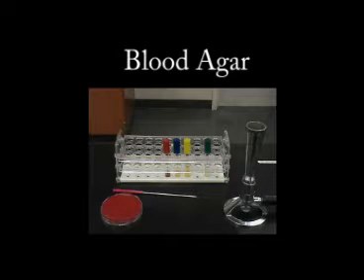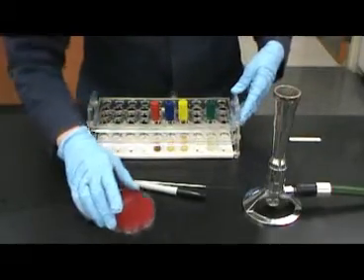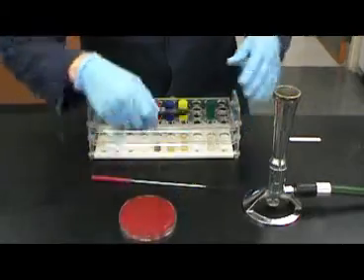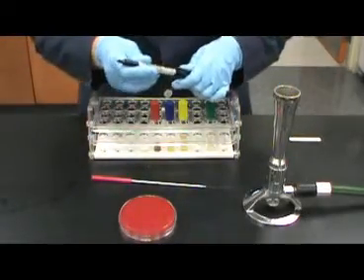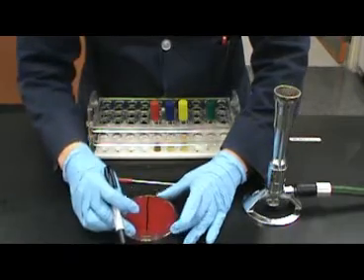The blood agar test. Blood agar is used to differentiate bacteria based on hemolytic activity. Hemolysis is the process of destroying red blood cells in order to use their contents as a nutrient source.